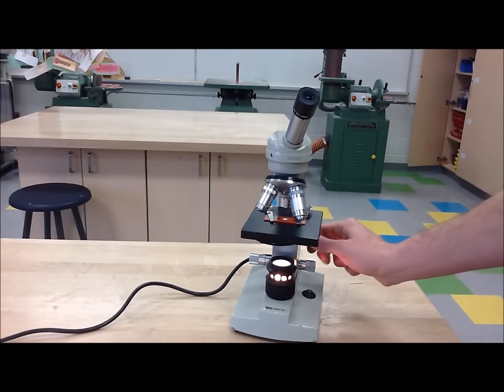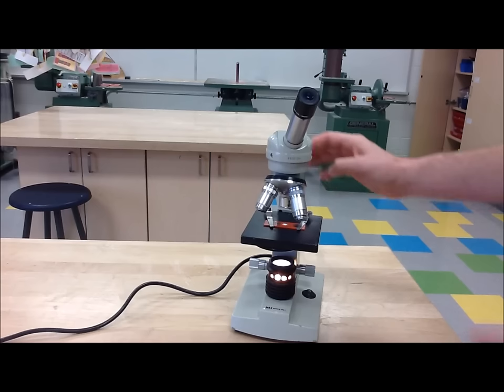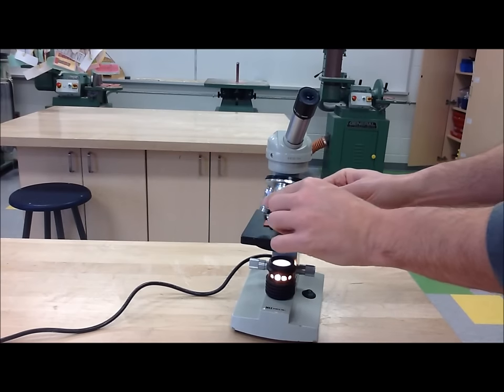Step 11: Now you can try and use the higher objective lenses to see the image even closer. But remember, it may take some time.